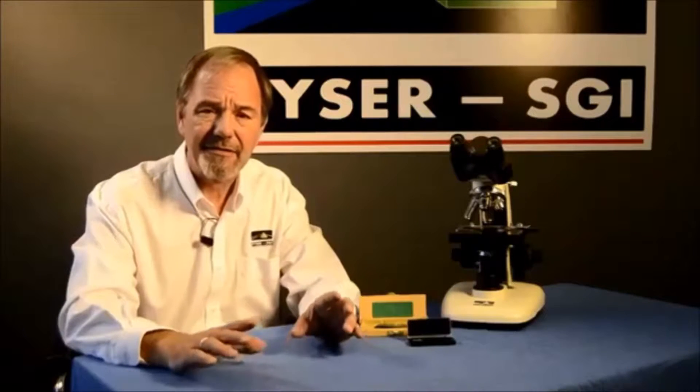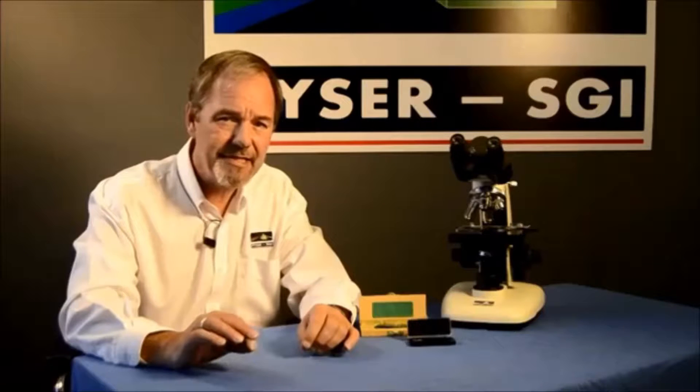To reveal the calibration of our eyepiece reticule and what each of these 100 divisions is measuring, we need to compare the scale to another scale of a known length. To this end we use a stage micrometer. A stage micrometer is about the same size as a standard microscope slide but it holds a small precision fine-lined scale image. This small scale is magnified by the microscope in exactly the same manner as any sample or subject.